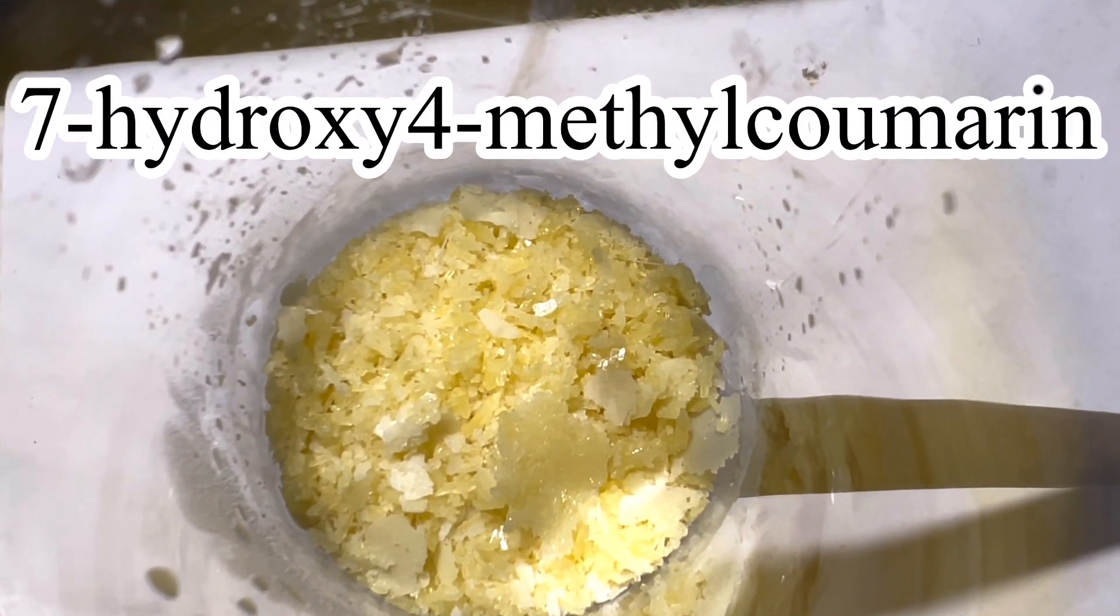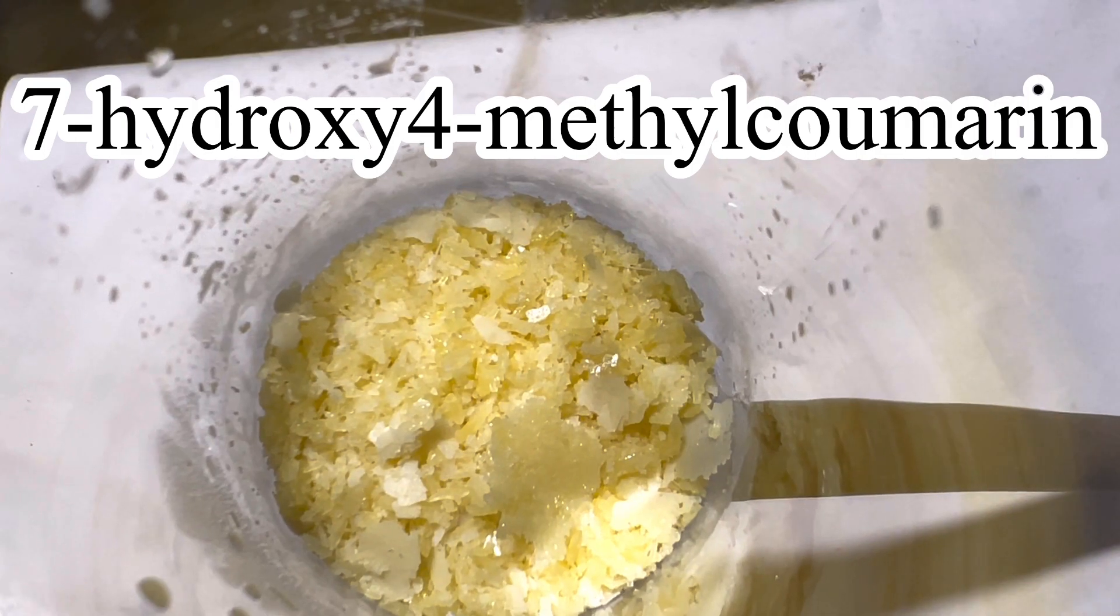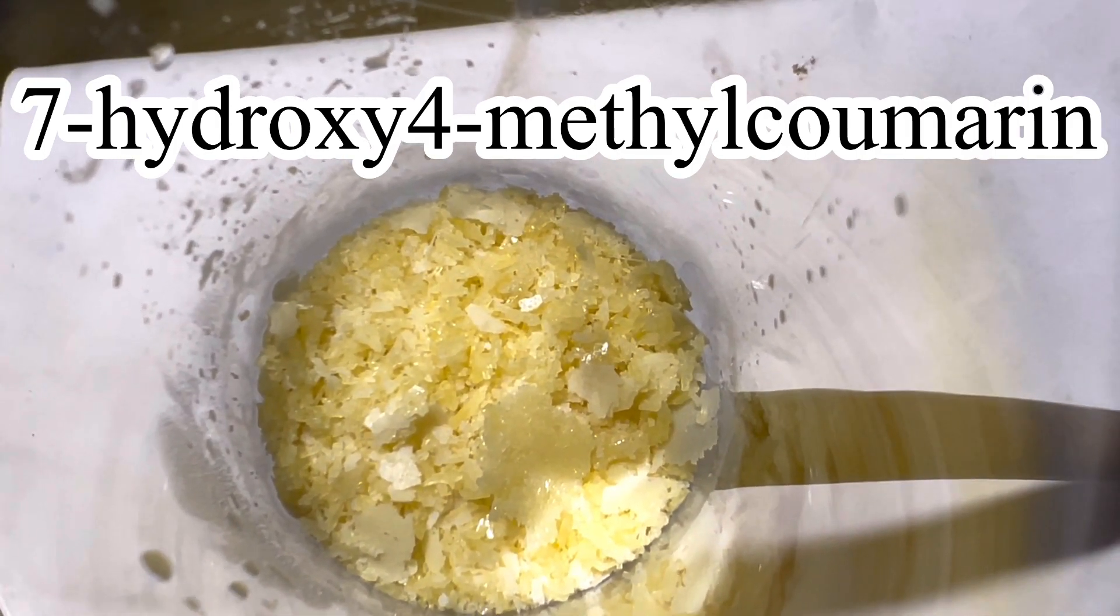Hello friends, in this video we will be synthesizing the compound 7-Hydroxy-4-Methyl-Coumarin.